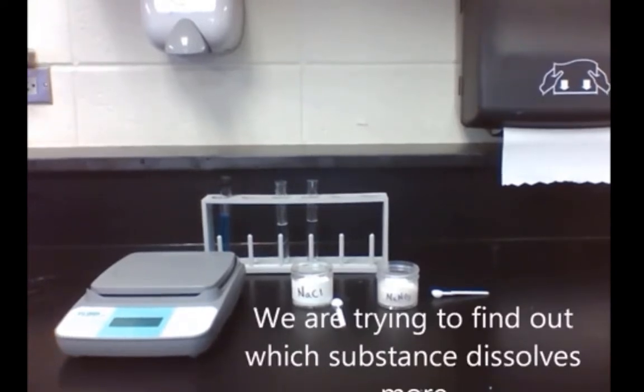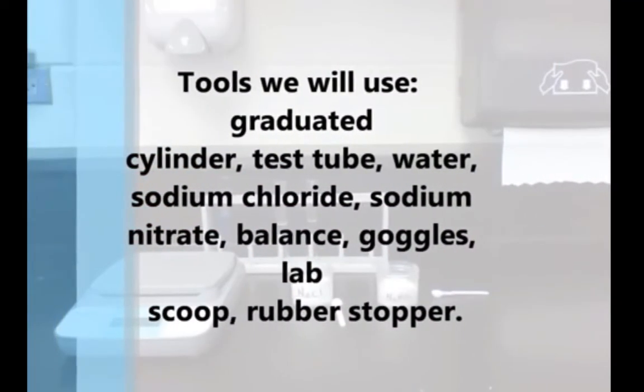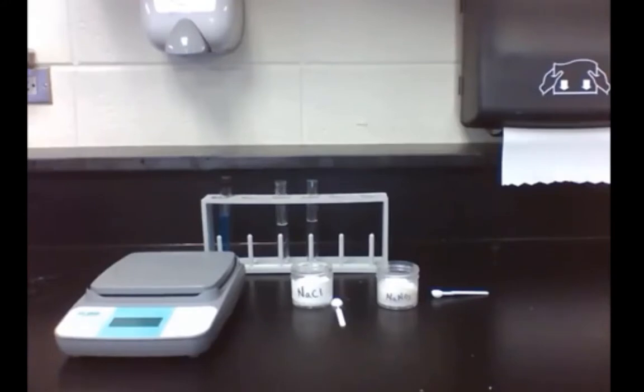We will need to measure the amount of solute dissolved for each substance in grams. We will know when we have a saturated solution when the solute is unable to dissolve any more in the given amount of solvent. We will calculate the amount dissolved by subtracting the new mass of the jar from the original mass of the jar. And we are going to find the solubility of salt and sodium nitrate. Which substance will dissolve more in equal amounts of water?